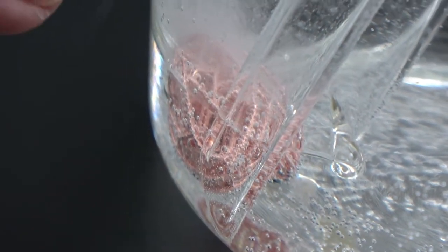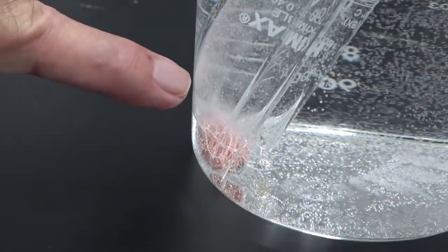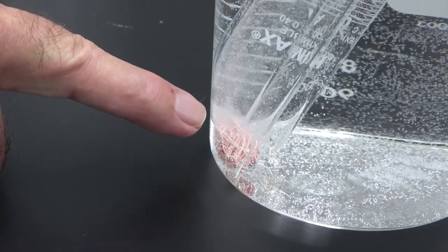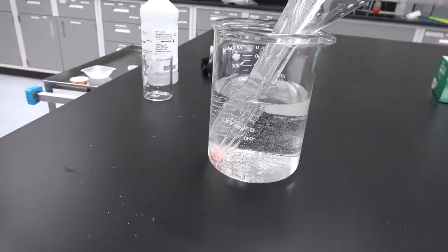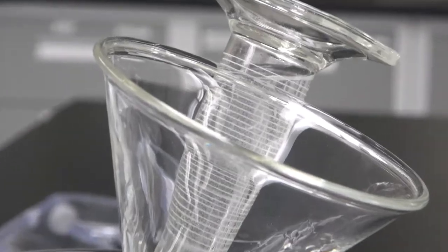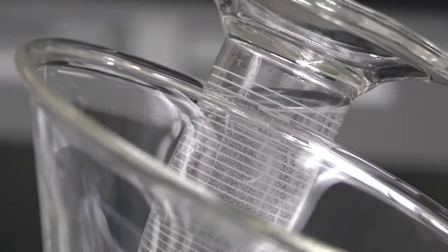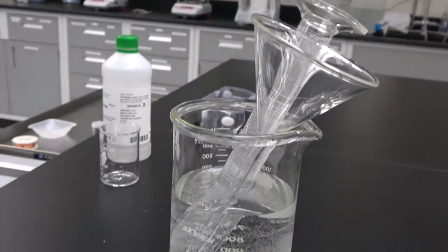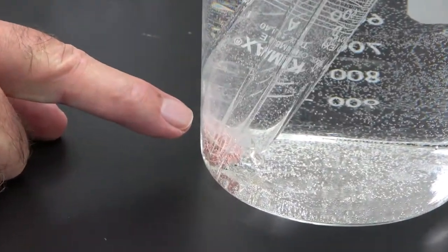Okay, you can see now that a gas is evolving. You can see the bubbles, and the bubbles represent the hydrogen that is being evolved from the reaction, and that hydrogen is being trapped here at the top of, or the bottom in this case, of the cylinder. So you can see that the hydrogen that is being collected is pushing the water down. You have to wait now for about 20 minutes until you see that no more bubbles are coming out of the copper cage.